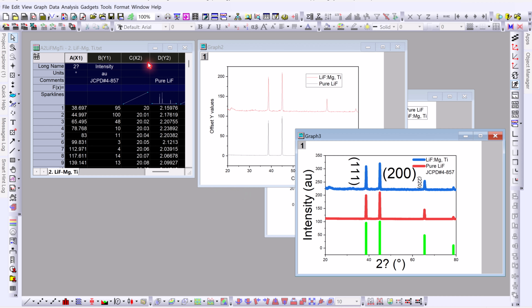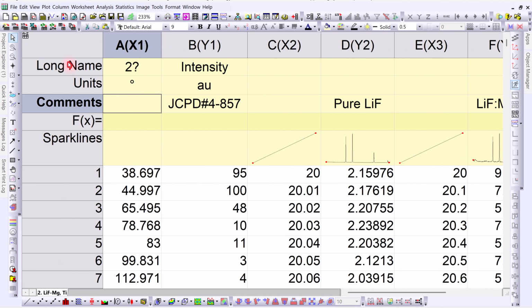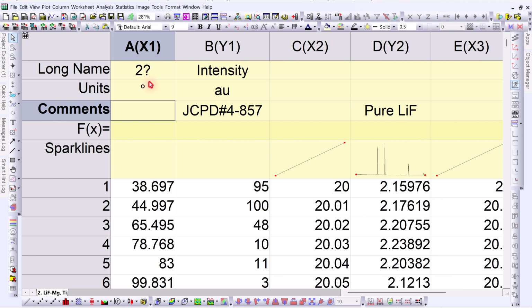And here we have a plot of XRD data. But here you can clearly see that the symbol we used earlier, like theta and two theta, is gone. Instead of the symbol, I am seeing a question mark. Now the problem is, every time we reopen the project, we face the same issue.